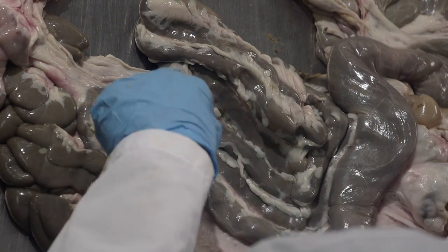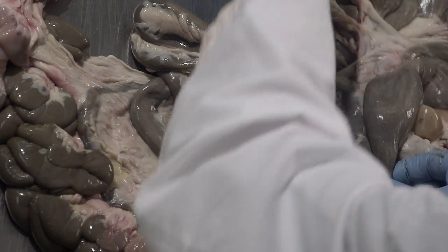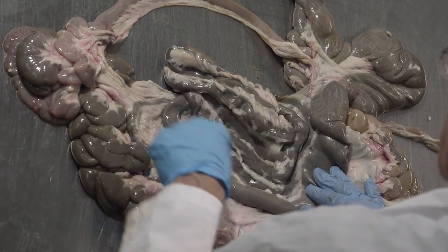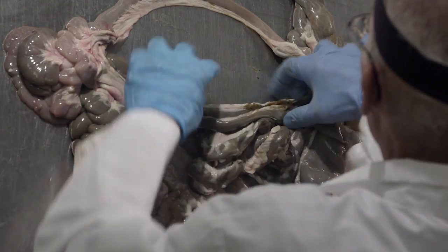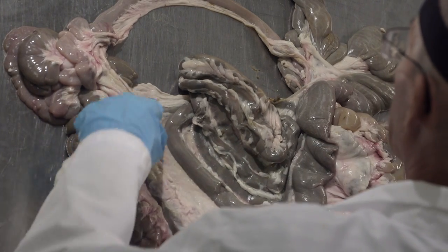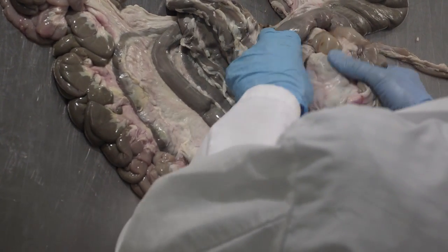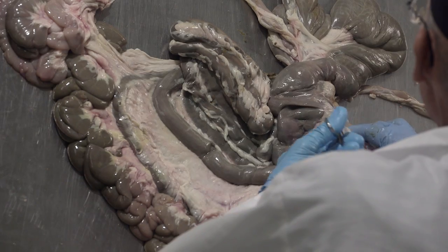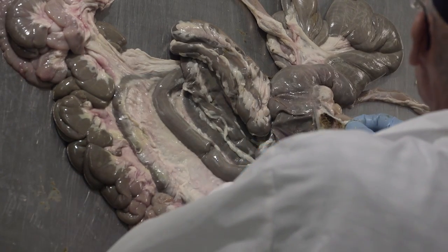And in the case of sheep, this is the part of the colon where we get a lot of water reabsorption. So microbial digestion going on in here, in the cecum portion, the proximal colon. But then when we get into this spiral colon portion here, it's much more water reabsorption that goes on. So it passes down through these loops of the colon and then eventually comes out along here. You're actually seeing the last part of the colon, and if we can just track that down a little bit further, you get down to where I'm going to open up this portion, and we should see some very dry fecal material.